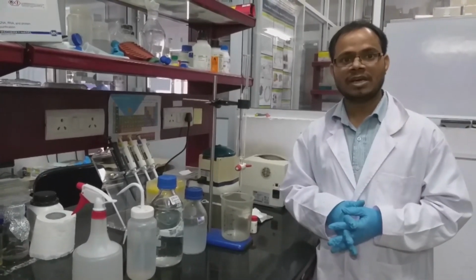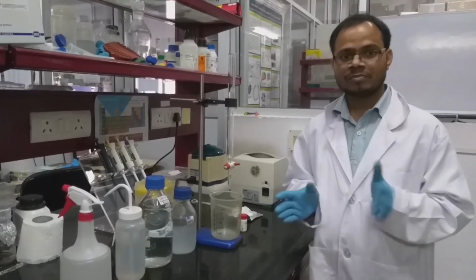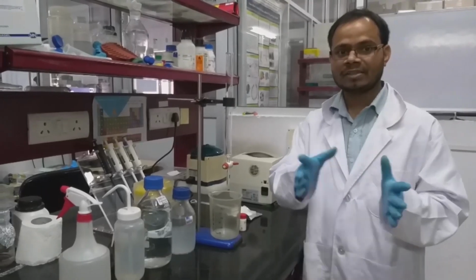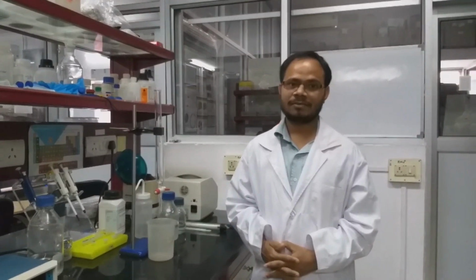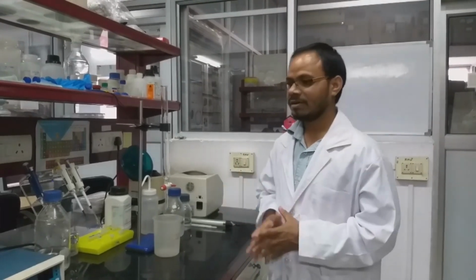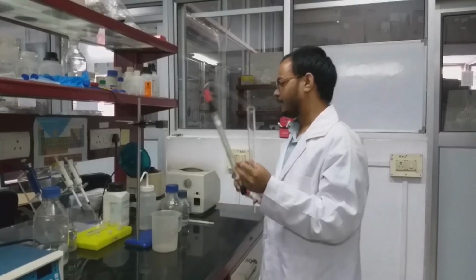It is widely used in the separation of proteins, peptides, or oligonucleotides. In this video we will show you how to pack the column first and what buffers are required. For gel filtration chromatography, there are two kinds of columns available: one is pre-packed columns, and another is column material which can be used for packing the column. Here we will show you how to pack a column, and also we have a pre-packed column.